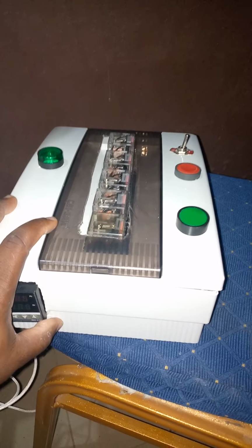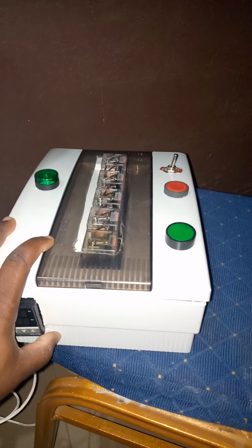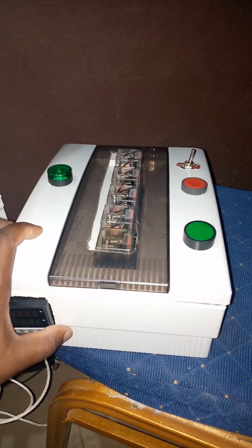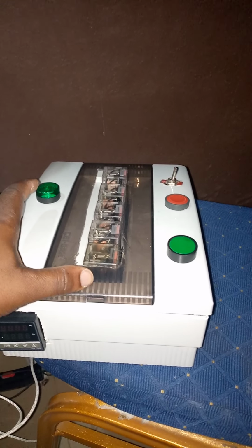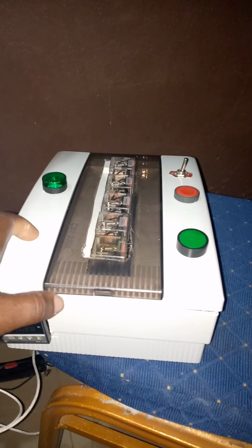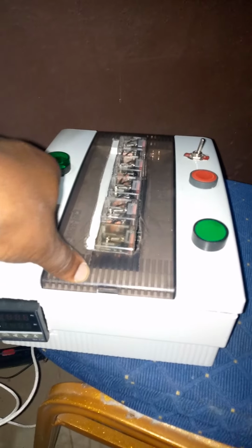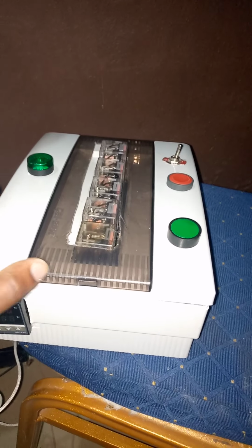So this is the model that is being developed, and its function is to monitor moisture content in the drying chamber, and it could also monitor the pressure drop in the chamber. And when the temperature and pressure drop in the chamber reach a fluidization point, the model would end the drying process.